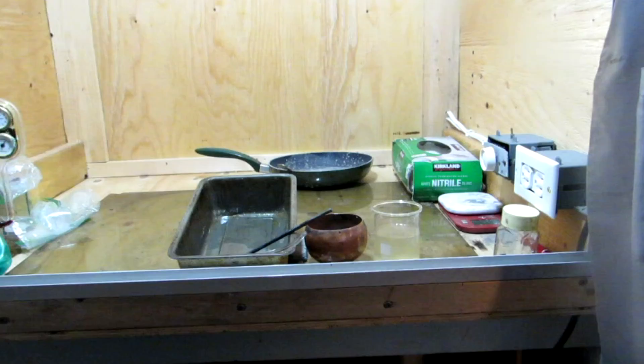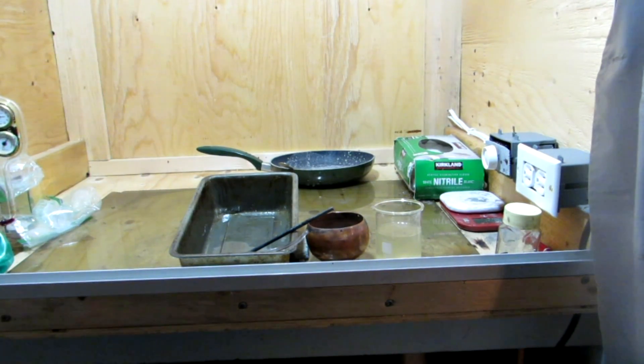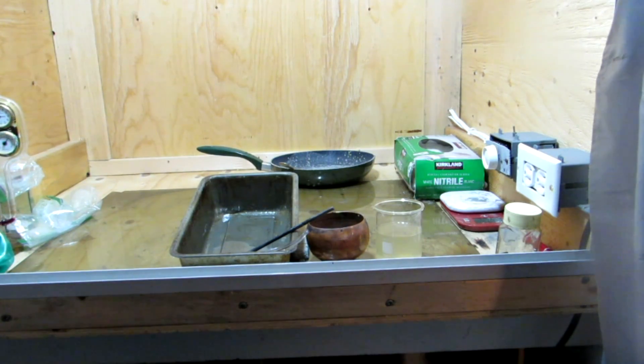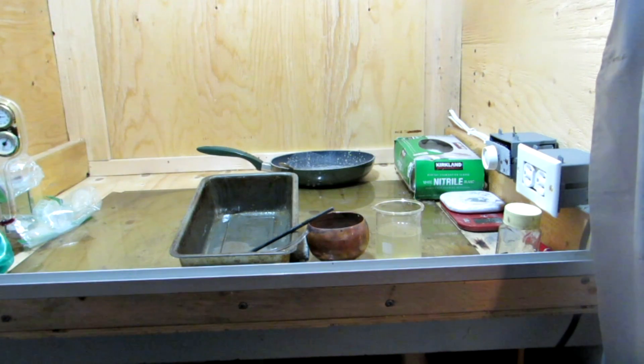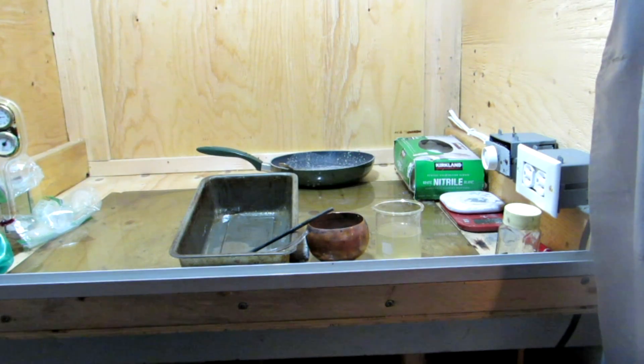I put it on a hot plate and boiled everything down. However, we ran into some issues along the way. There was some extremely intense bumping which occurred, and one beaker actually broke. I've never had this happen, but it's not a big issue about the beaker, but I am sad that we lost half our yield.